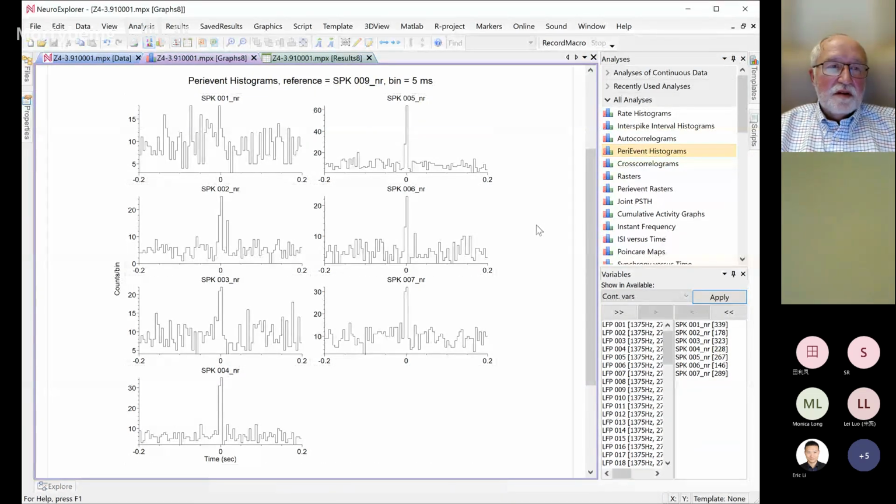By event, I mean timestamps. Timestamps when you did the stimulation.